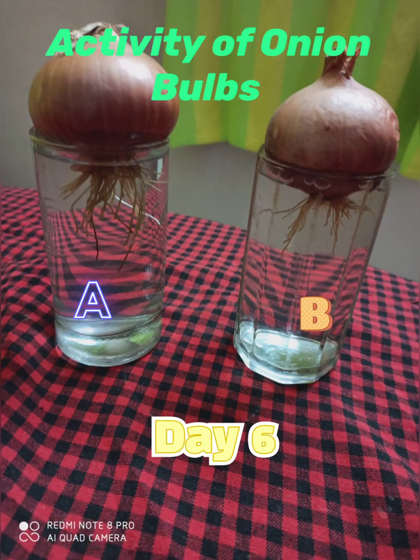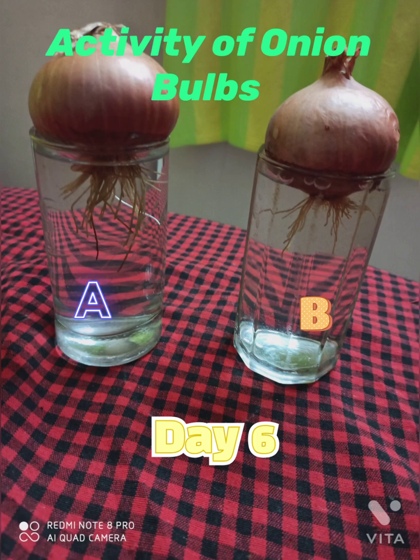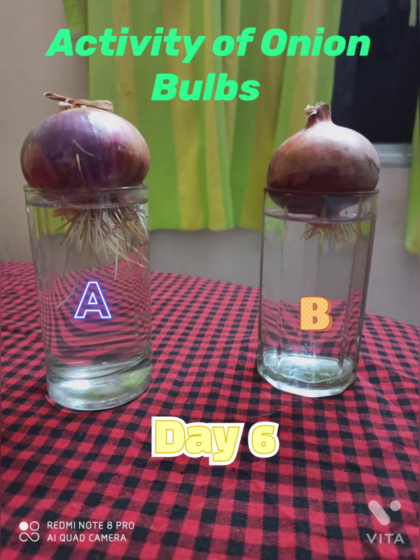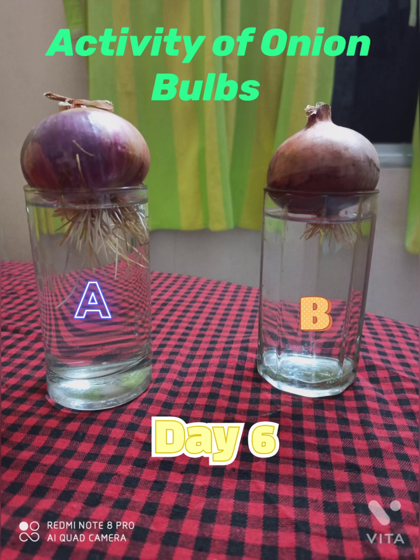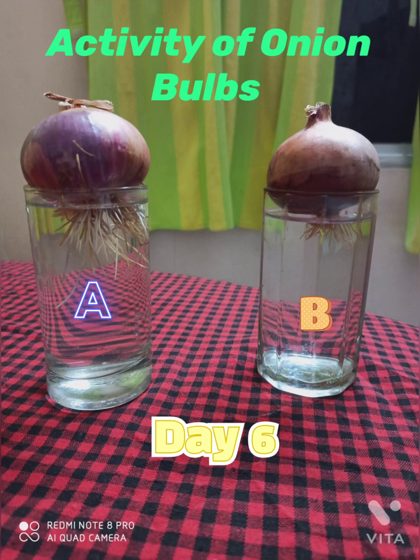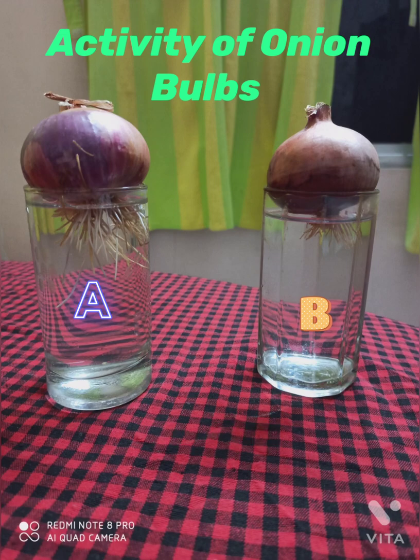This is the observation of day 6. On this day I have cut the roots of beaker B to show that the onion has apical meristem. As you can see, beaker A whose root tips were not cut is showing rapid growth, whereas beaker B whose root tips are cut is not showing any growth. That shows that apical meristem is present at the root tips.